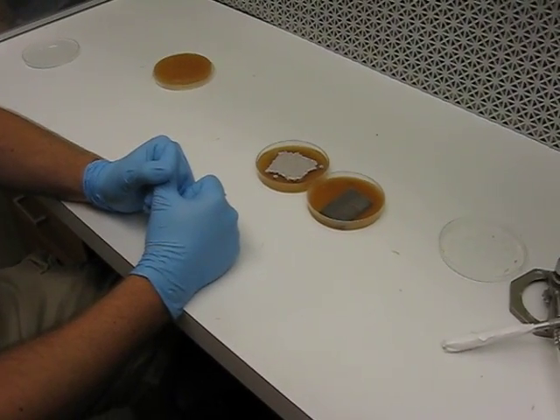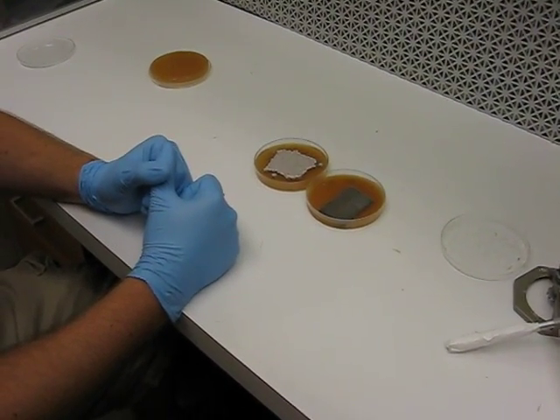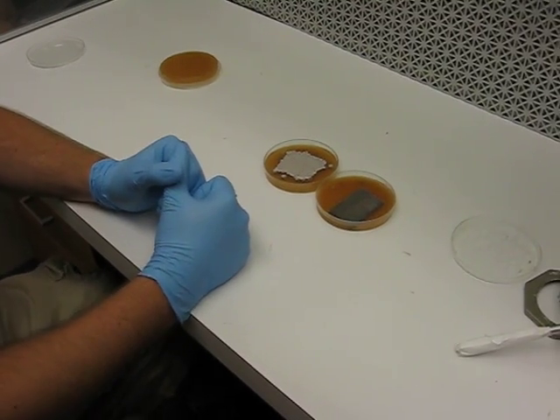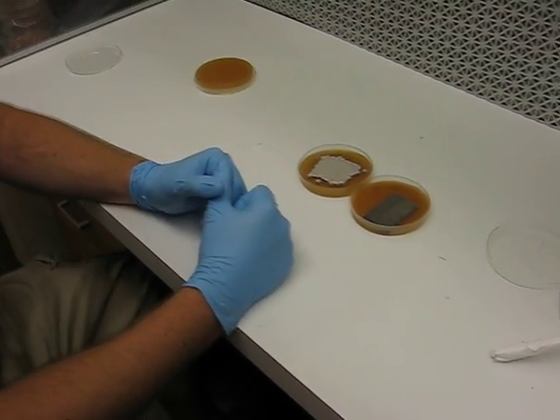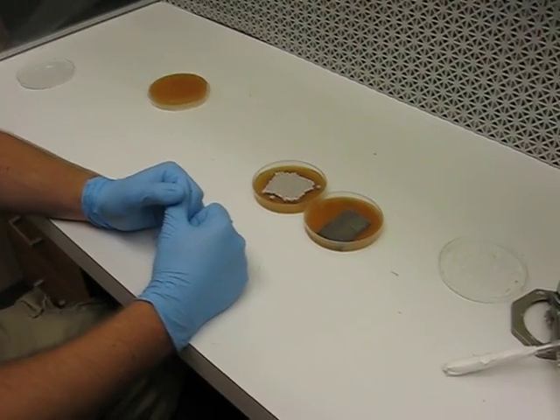All right, today we're going to subculture Cercospora. There's a couple considerations when working with Cercospora. You always want to do it aseptically, in a hood, using really good sterile technique.